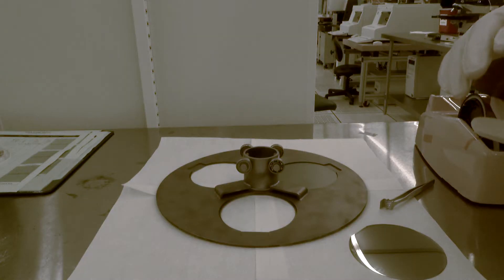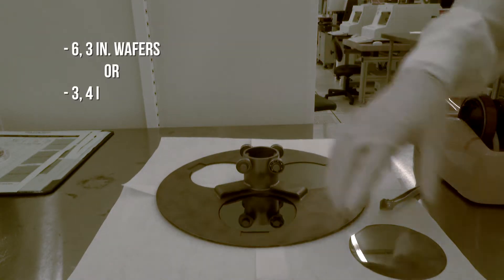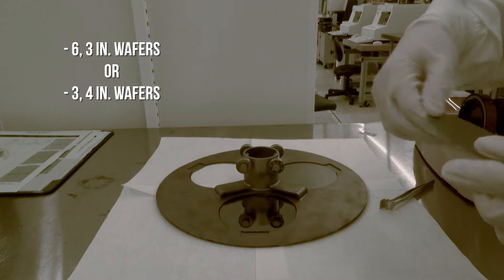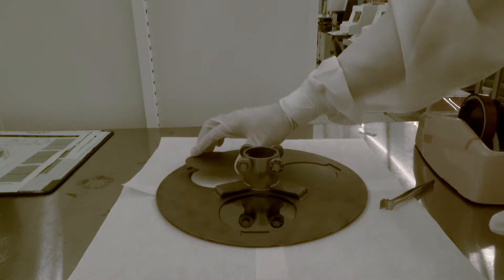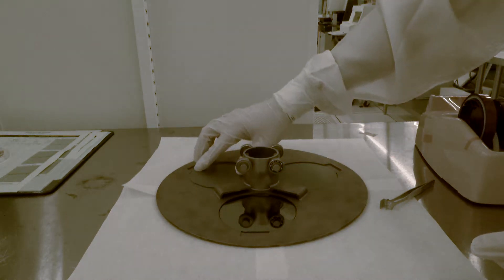The machine has the ability to hold up to six 3-inch wafers or three 4-inch wafers during a process run. There are also 4-inch blanks available for attaching smaller samples to.